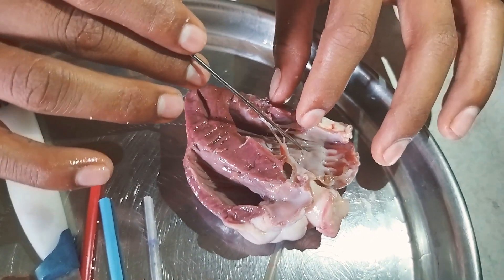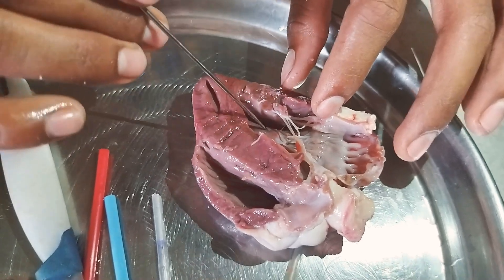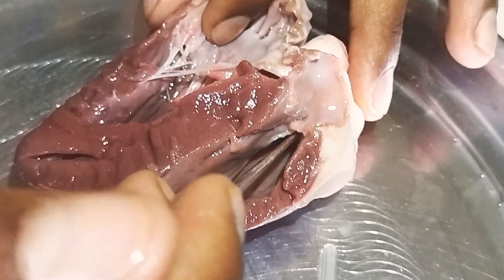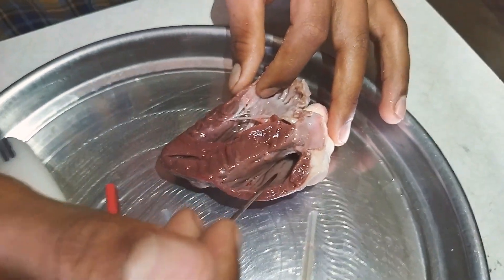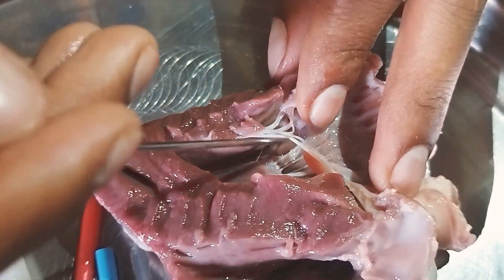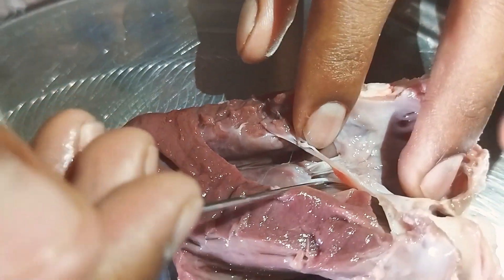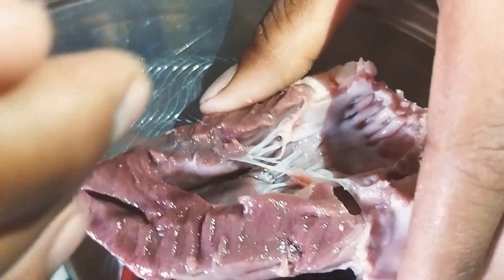Here is the right atrium. On the lower side, this is the tricuspid valve, and this is the right ventricle. The upper side has the left atrium, and the lower side is the left ventricle. Between these, we have the bicuspid valve. You can observe here — this is the bicuspid valve and this is the tricuspid valve. This thread-like structure is very strong; we cannot break it. It will close and open the valve.